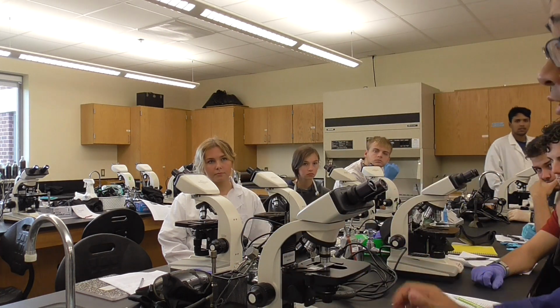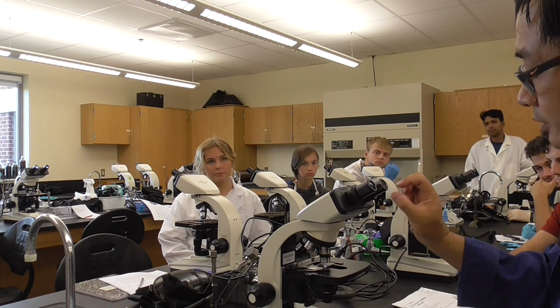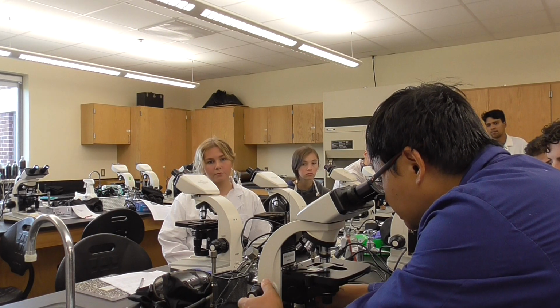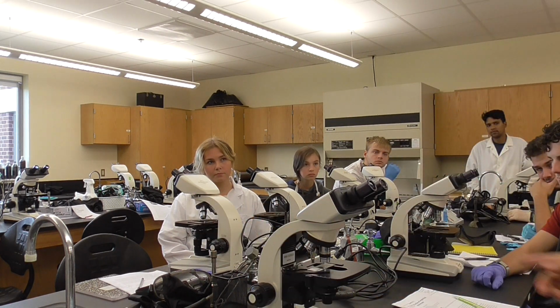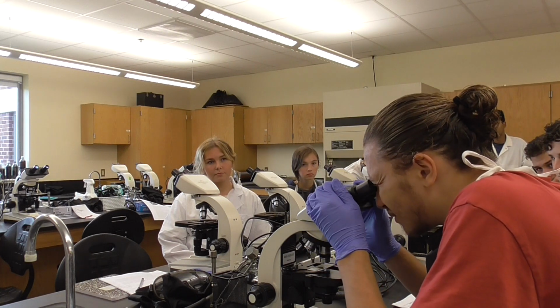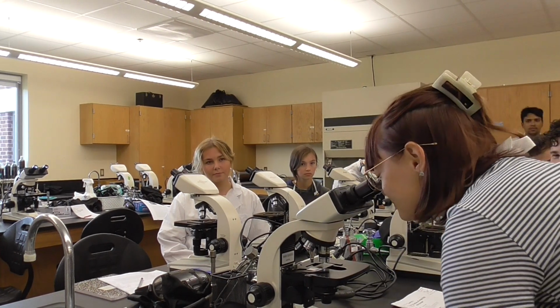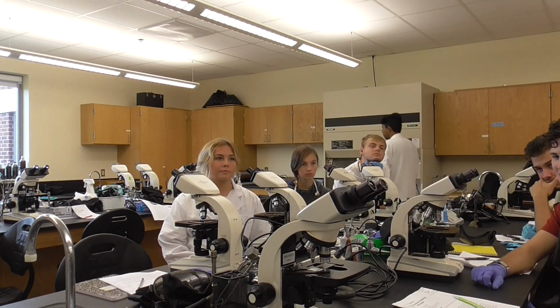It will not break it. There's a distance between the objective lens and the slide. So then what you do is slowly go down, go down, go down a little bit. Then you can see something. Go ahead to see what it is. You can see something, is that right? Yeah. Okay, come here to see what it is. I'll give another student a chance to see. Can you see it? You can see something. Not very obviously, but you can see at least something there.